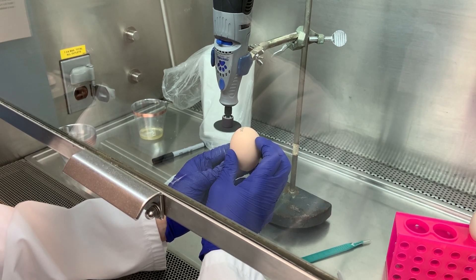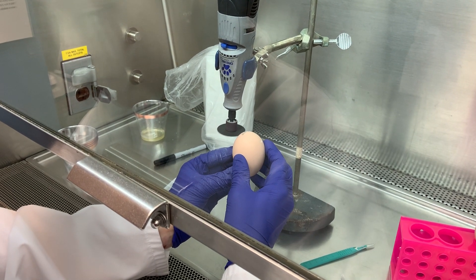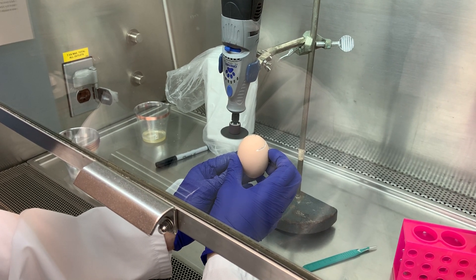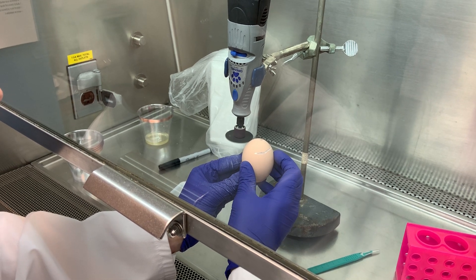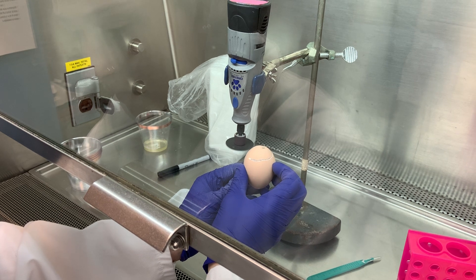Scoring it — a long line, a circle around one end of the egg, being careful not to rupture the membrane that is just under the eggshell.